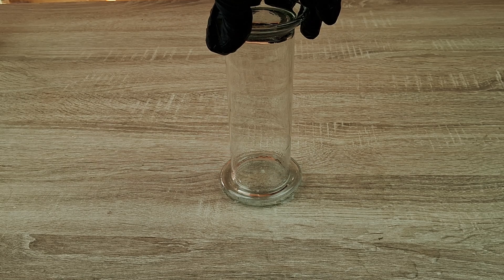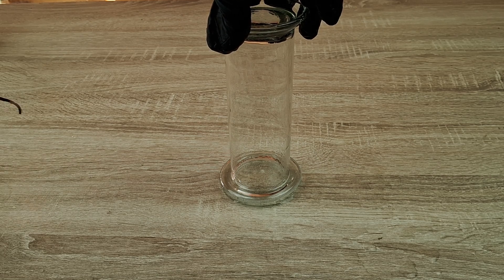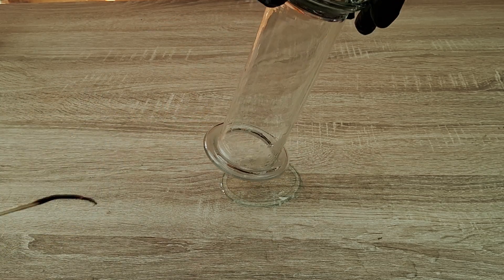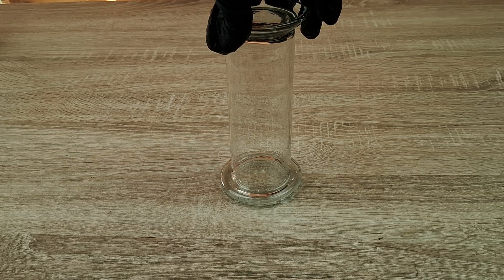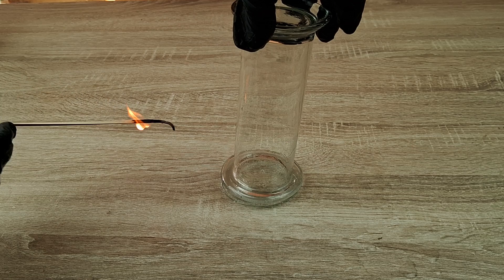Remove the lid from the jar while still holding the jar upside down and bring a burning splint or a candle or a lighted matchstick close to the mouth of the jar. You will observe that the gas in the jar violently ignites with a characteristic pop sound.